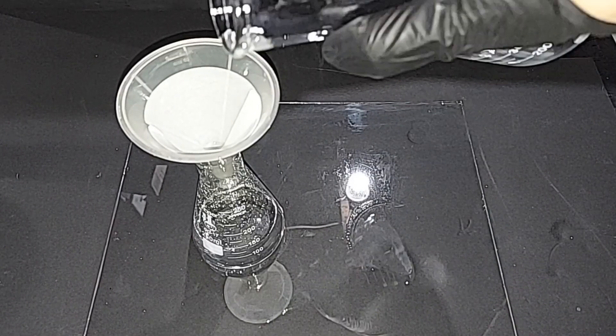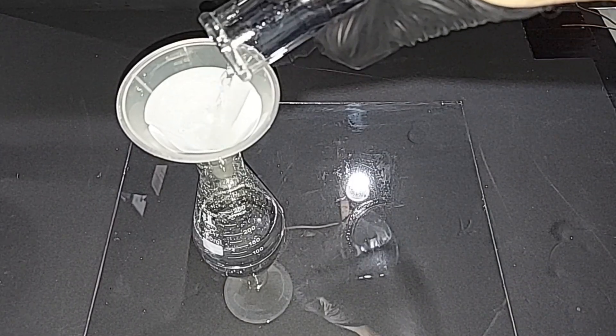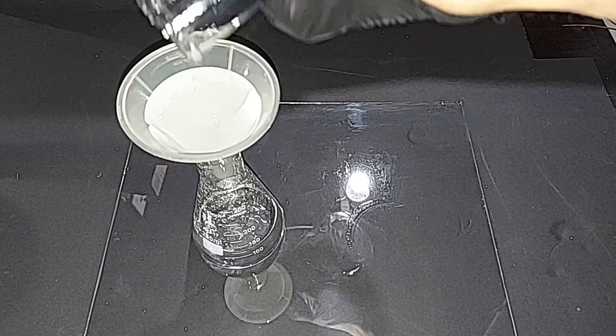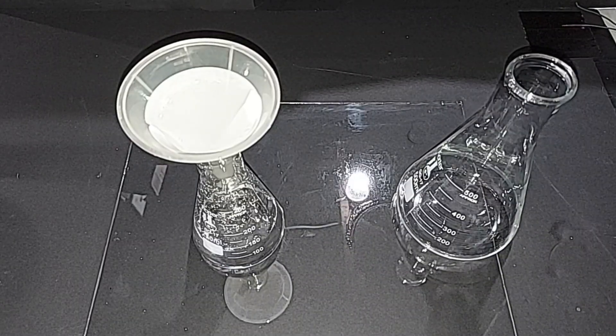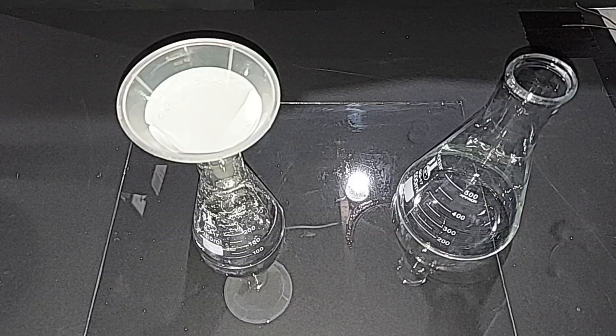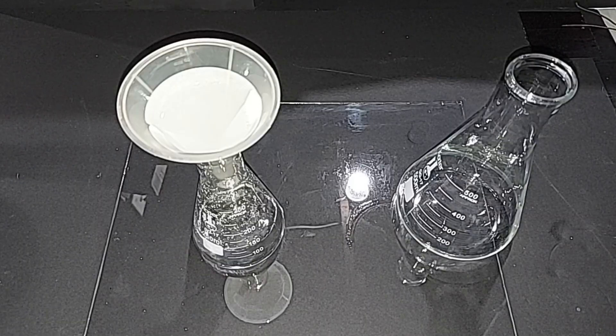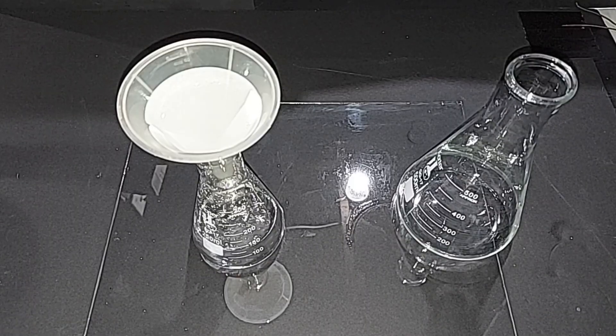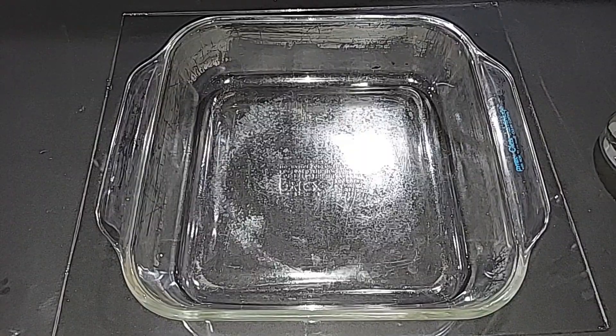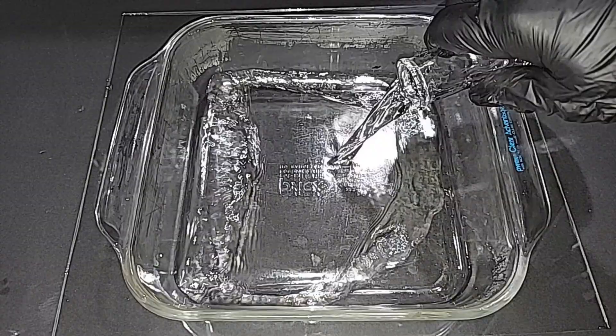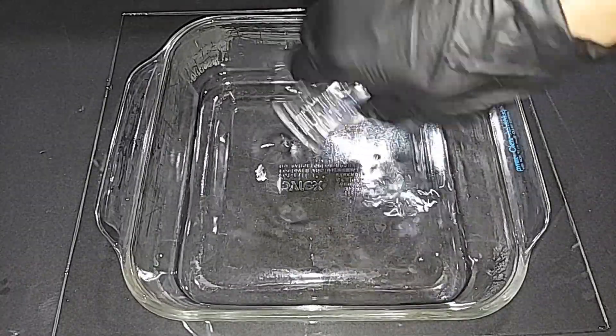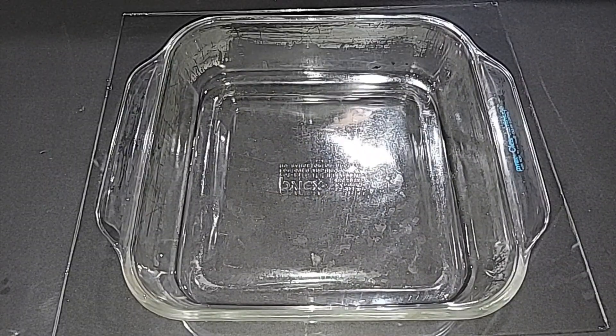Just the last bit going in here. You can't see it through the camera well, but the liquid on the bottom right here is extremely clear. All right, when that's done, we'll pour it into a wide dish and start to evaporate it. It's still dripping through, but you can clearly see a difference. There's no sediment in there whatsoever. We're at the last step here. I'm just going to pour this in here, dehydrate it, scrape out the crystals, and we're done.